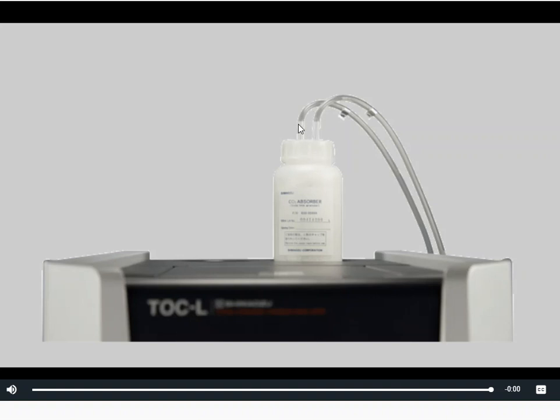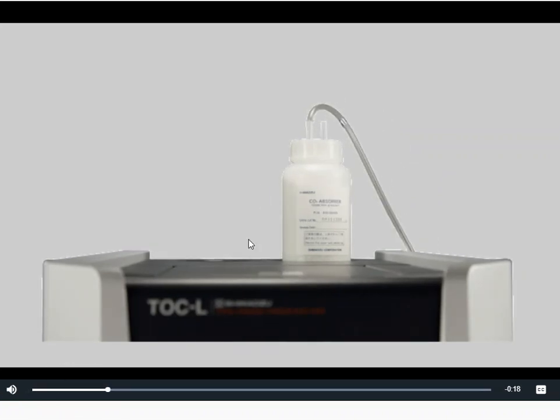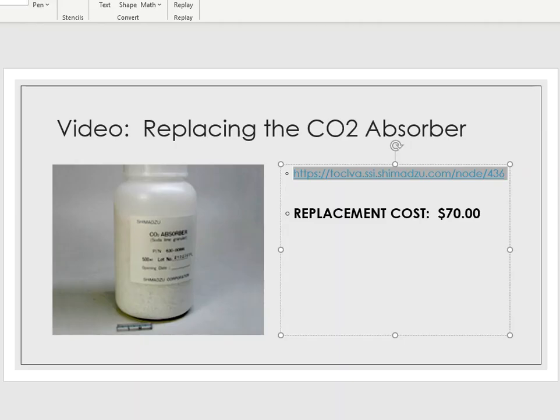If you didn't have that exit point and that second tube was not there, this bottle would continue to get air and CO2. And over time, of course, pressure would build up and it would explode the bottle. So we have to have an entry line and we also have an exit line. And that is the purpose of those two hookups at the very top. So again, it's just a simple, let's unplug them up here at the very top and let's replace the bottle. That's all there is to it, folks. And that is the story of the carbon dioxide absorber, or the CO2 absorber.